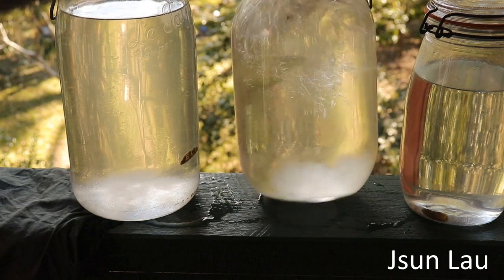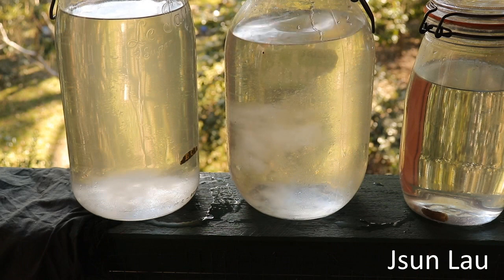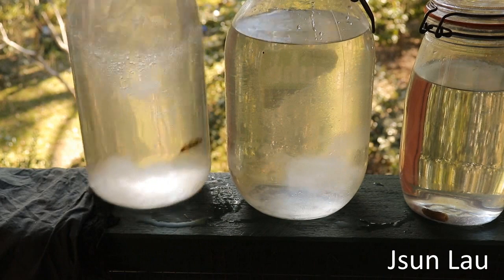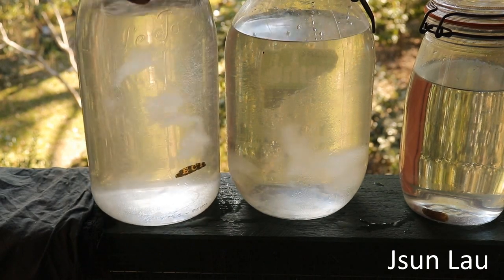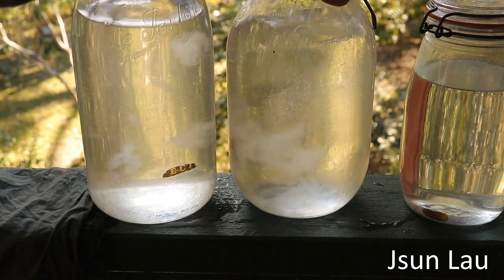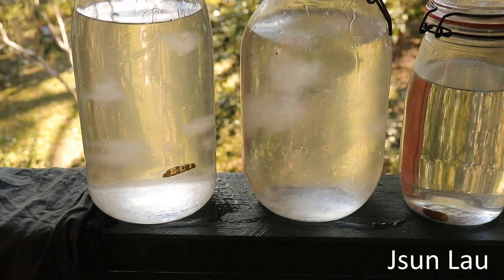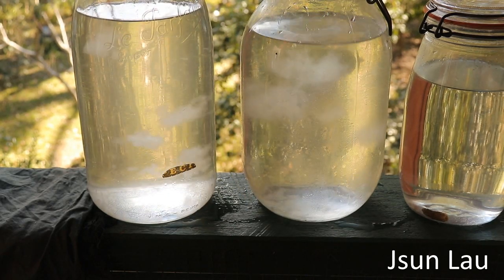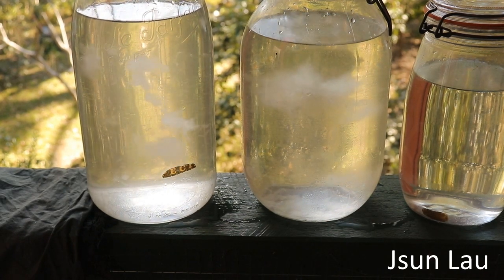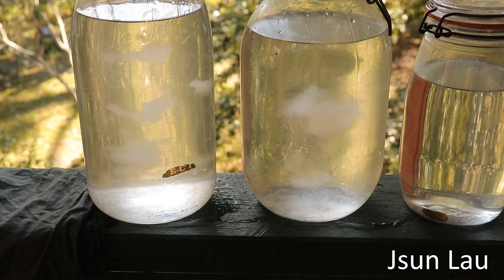Just give them a shake — you can see the big blobs of mycelium. From there they could be transferred into much larger containers. I could do 60 litre or 200 litre.